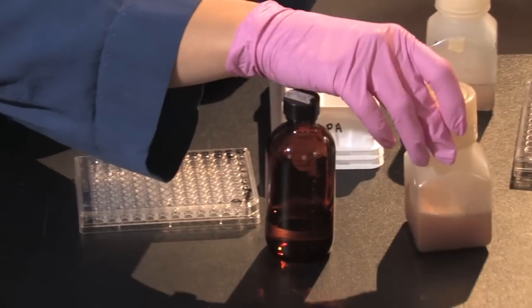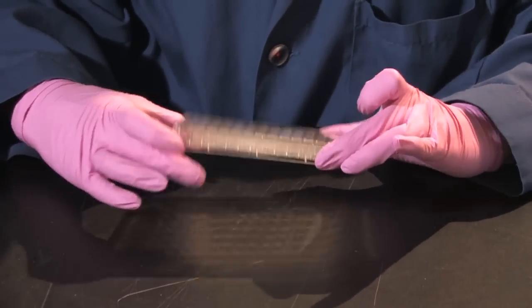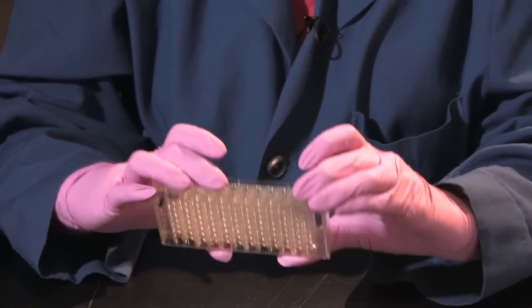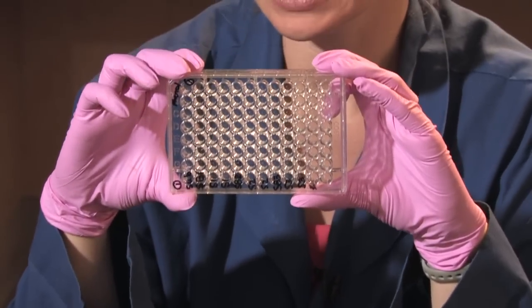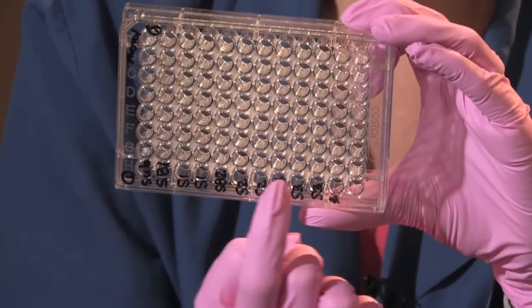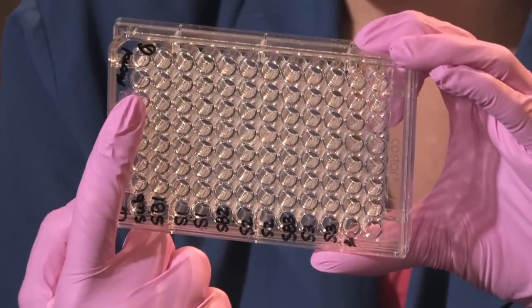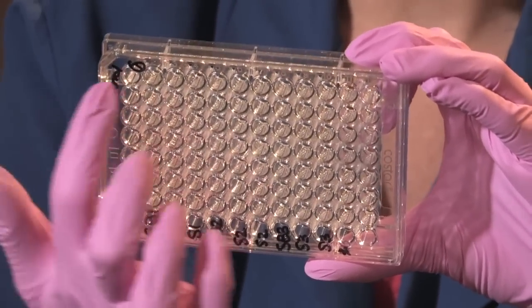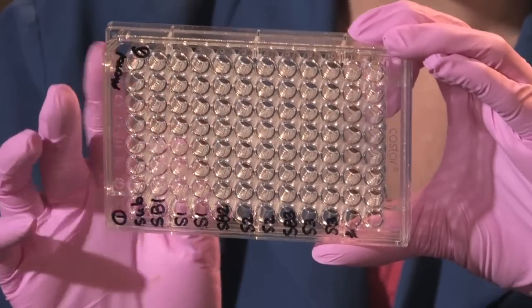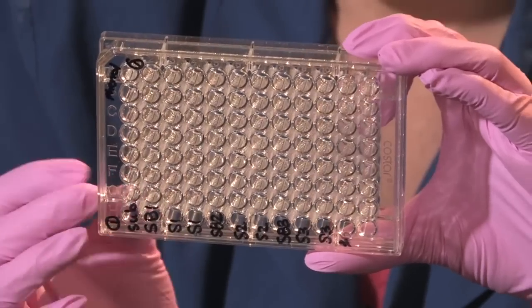So what I'm going to do to begin is set up my plate for my assay. And what I have is a 96 well clear plate. So I have labeled my plate along the bottom here with what's going to be going in each well or each row of wells. I have 12 rows of 8. So each sample is replicated the 8 times or each row.